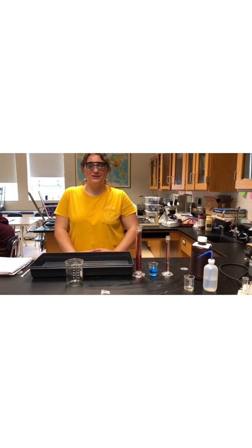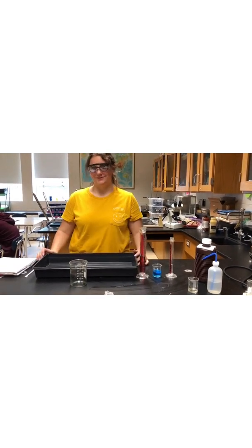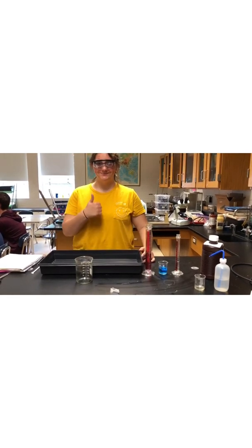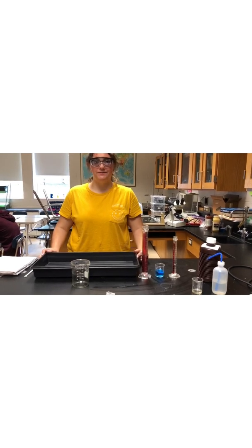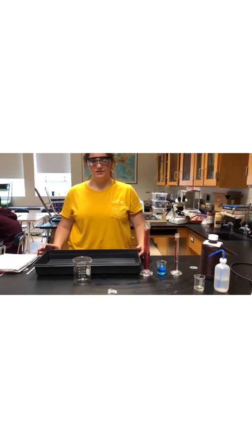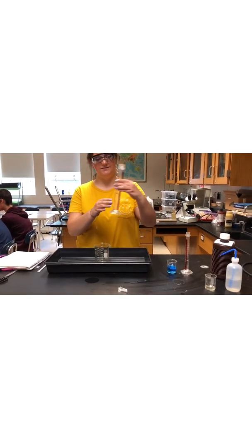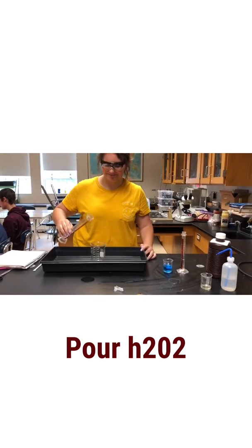Hello, it is Dr. Catherine. It is evident that Dr. Petty is not in the room right now, so I will be continuing this experiment by myself. As we said before, we would be doing the experiment with 30% hydrogen peroxide. So, this is 30% hydrogen peroxide, 50 milliliters.